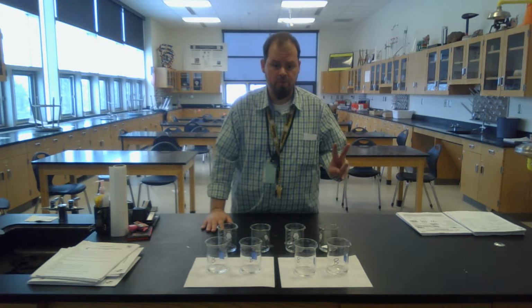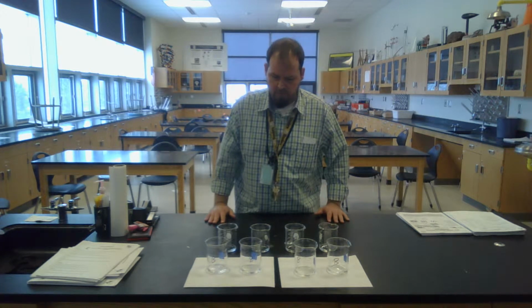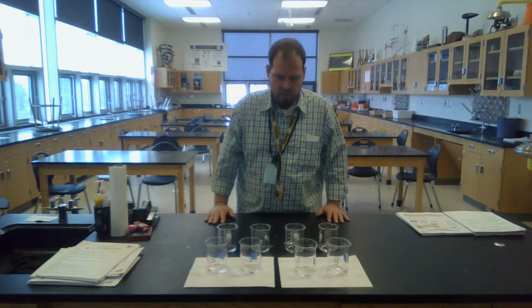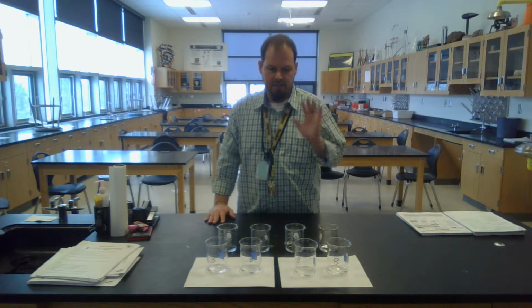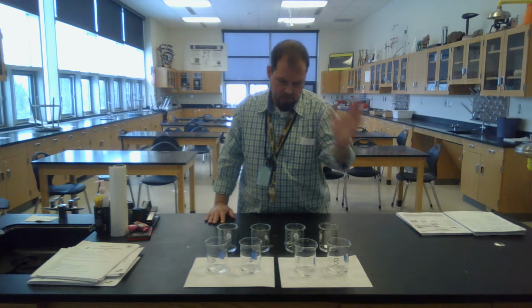Retake number two. My lab assistant is no longer with me. I'm going to try this over again. So let us just first go through the demonstration and see that it works, and then I'll talk you through what I want to happen.